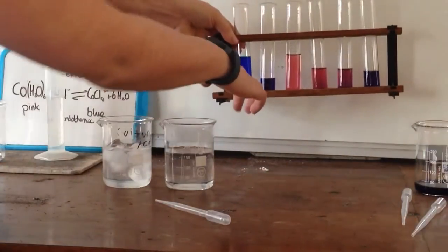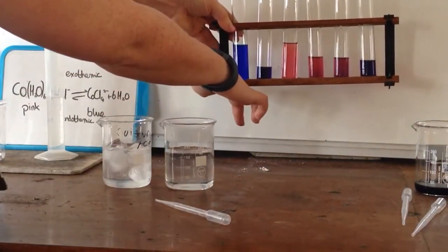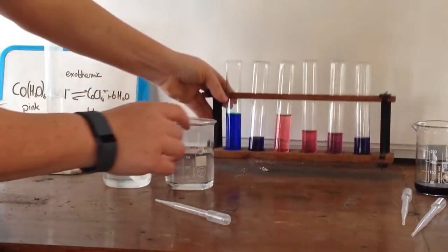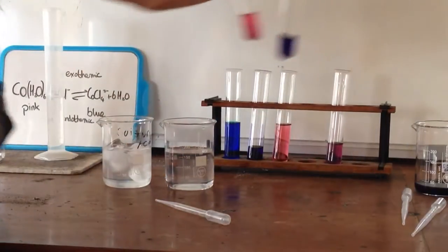And pop those back over here so you can see it. I'll just hold that up against there. So you can see this is where we started adding hydrochloric acid, adding water, this is where we started getting colder, getting hotter.